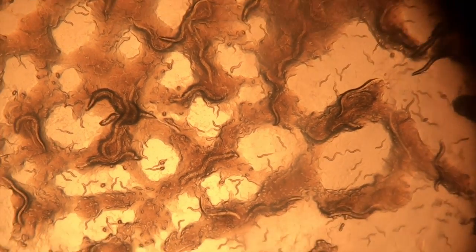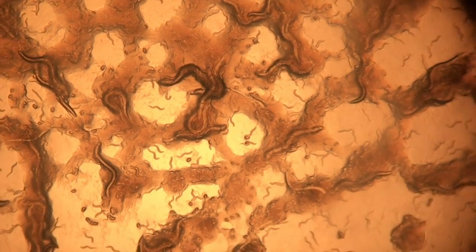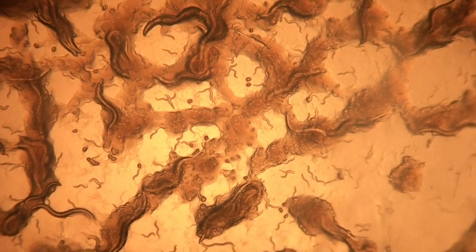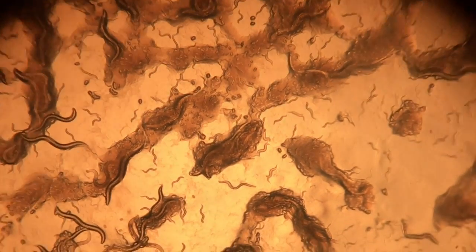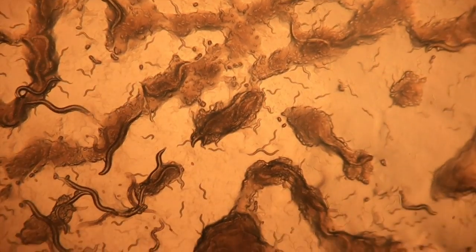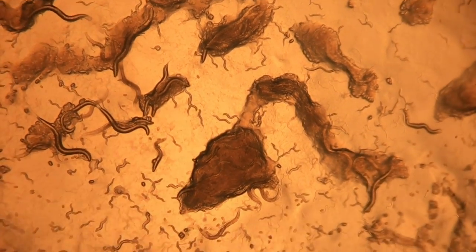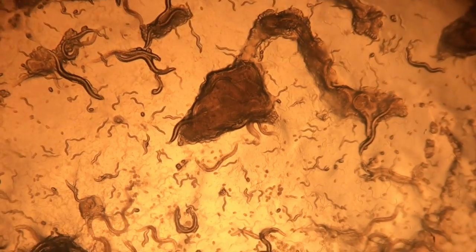When we observed the changes in the phenotype of the worms, we found that not only were there quite a number of dead worms, but most notably, the worms that were dead were shriveled up and almost entirely transparent. What had caused this change was blistering on adult worms. Individually, the blisters looked like a patch of transparency on their otherwise opaque bodies.